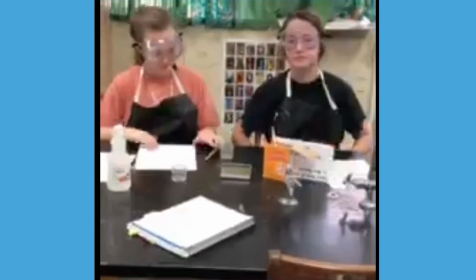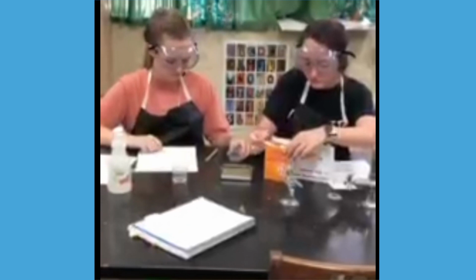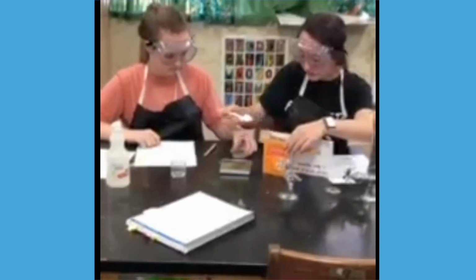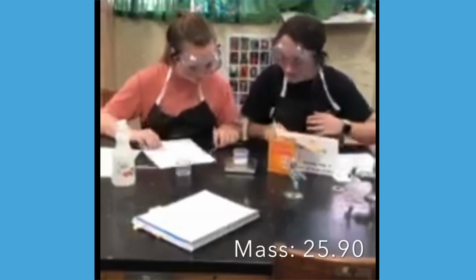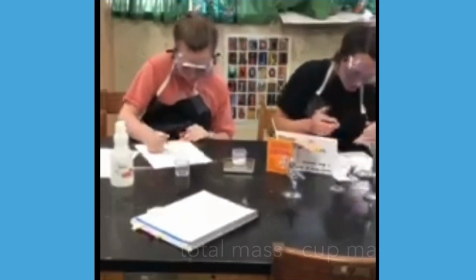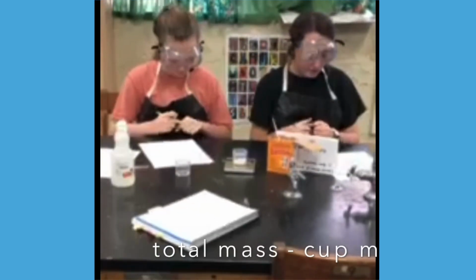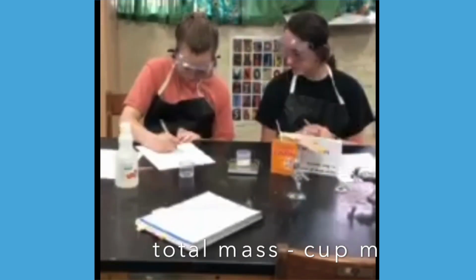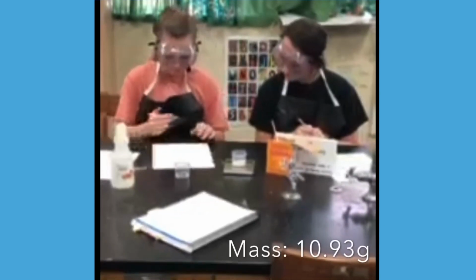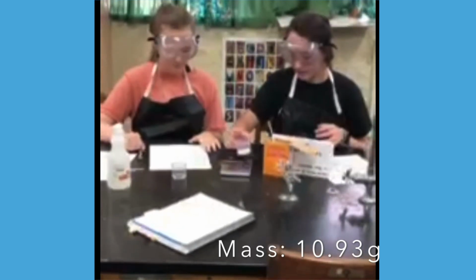So now we're going to put 1 teaspoon of baking soda into the cup. Then we're going to find the mass. 25.90. So now we got to subtract 14.97 grams from 25.90 grams. 10.93. Okay, so that is the mass of the baking soda.